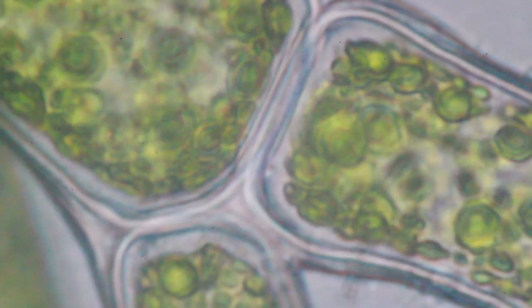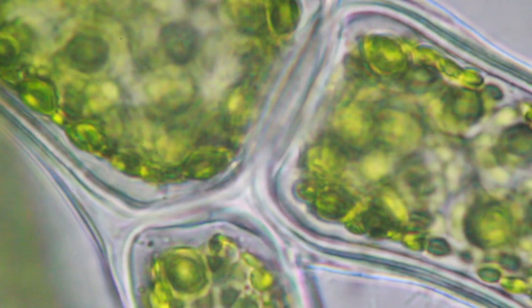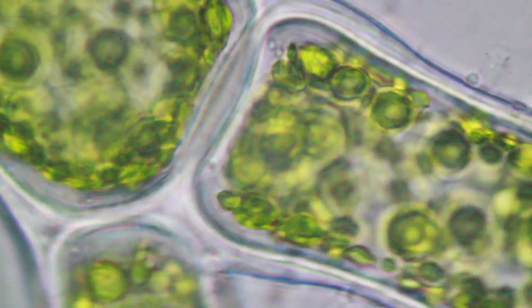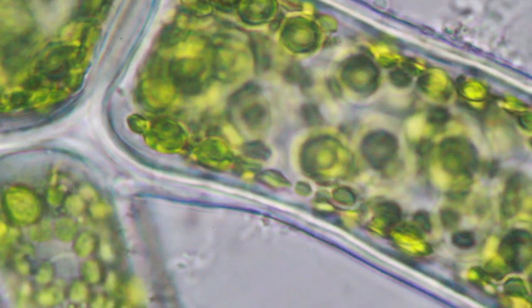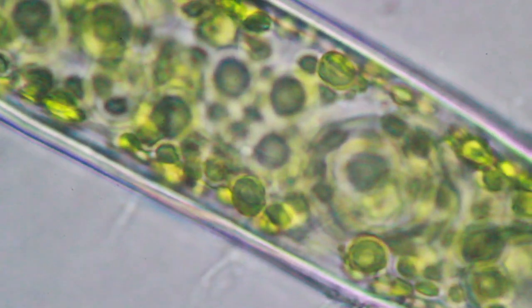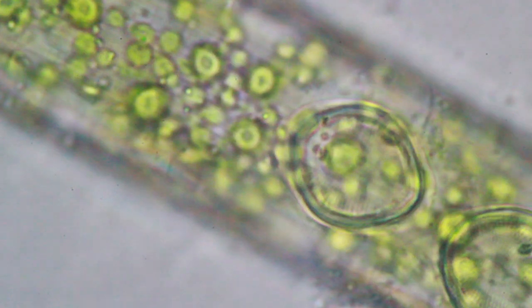This is now the 100 times oil objective without immersion oil. You can see it does look a little bit blurry. When I add immersion oil now, I found the same place again on the slide and this is how it looks with immersion oil. You can see the colors are much brighter and the contrast is also much better. But it's also much more sensitive, so for example the image is a little bit shaky, I'm moving it around of course, but even if it's stationary it's a little bit shaky because every small bump on the table is immediately transferred to the slide.